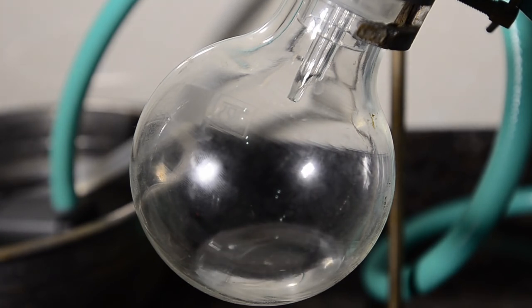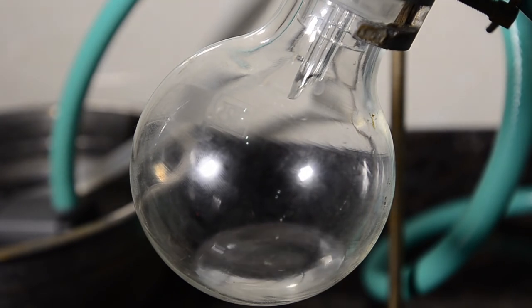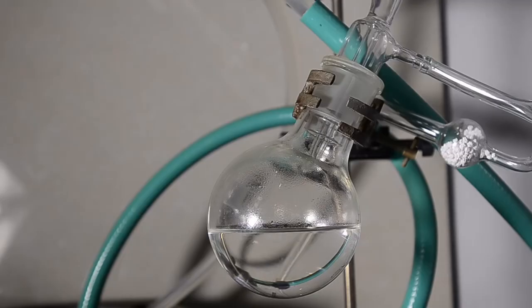Note that we performed the initial reaction twice and then combined the products for this distillation so the volumes you can see here are double.